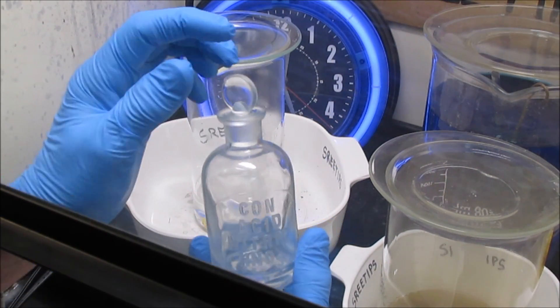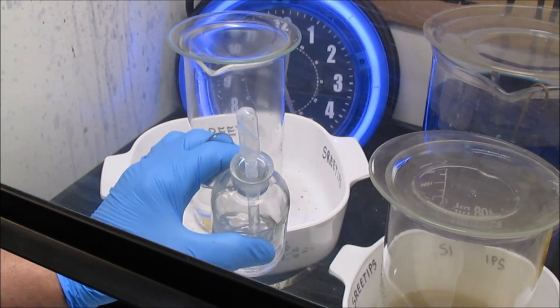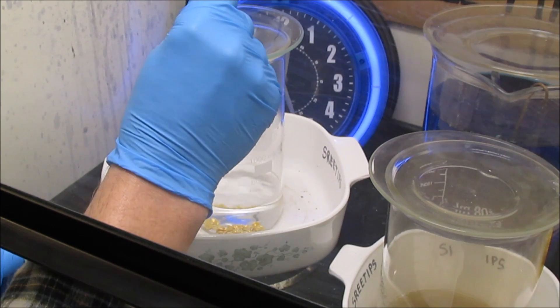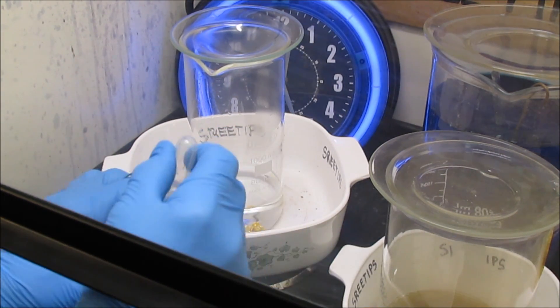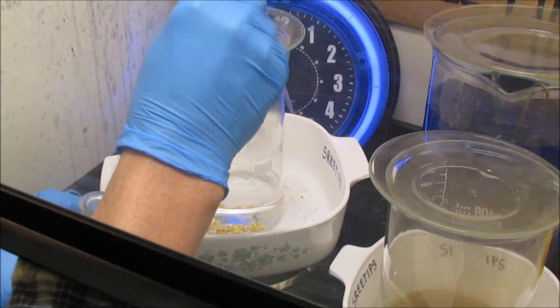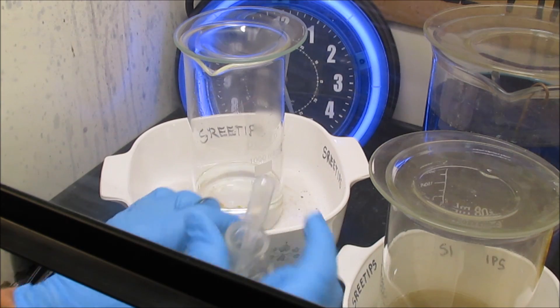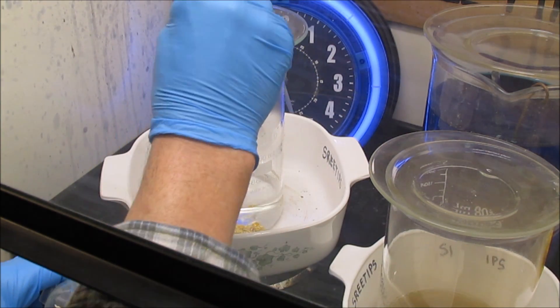I'm going to start adding small doses of nitric acid to get the gold to go into solution so we can repurify it. That's about 1.5ml, then 3ml, then 4.5ml, then 3 more — that's about 7.5ml of nitric acid in there with the gold.